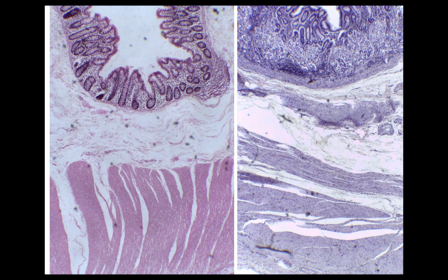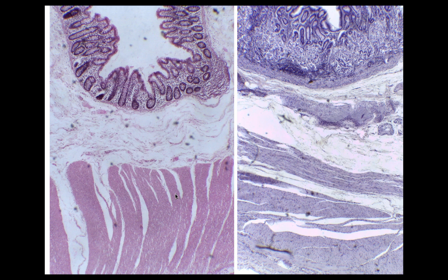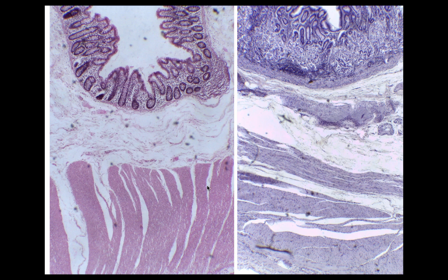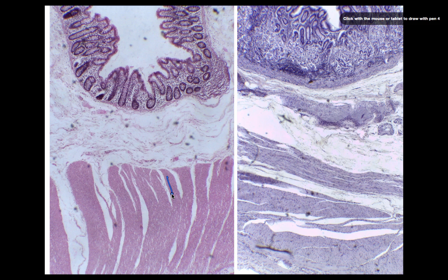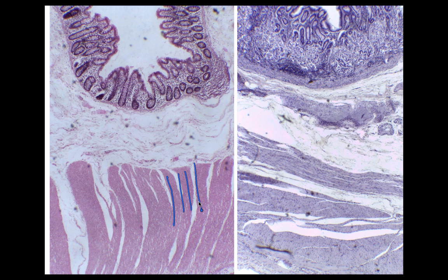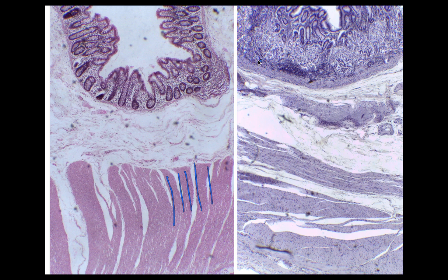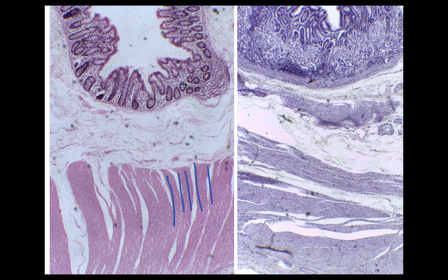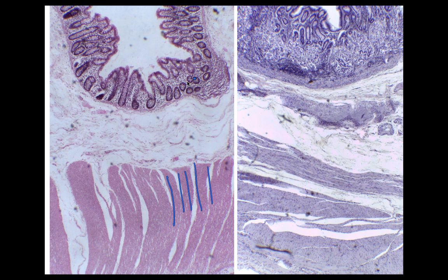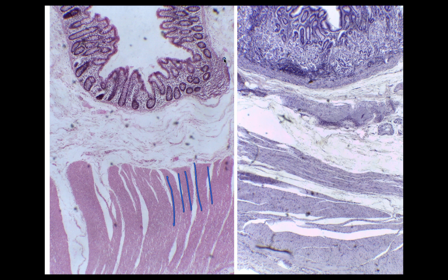I just wanted to compare these two since they do look pretty similar, so you can see that the colon's epithelial layer, or tunica mucosa, is one of the major identifiers — even though these two tunica mucosae look kind of similar at first glance.